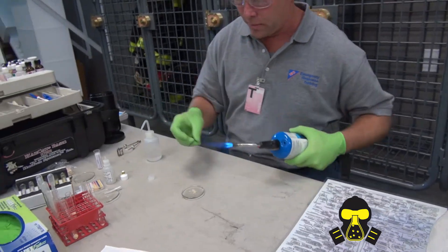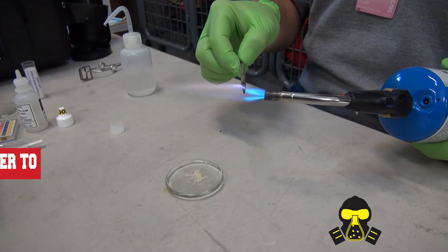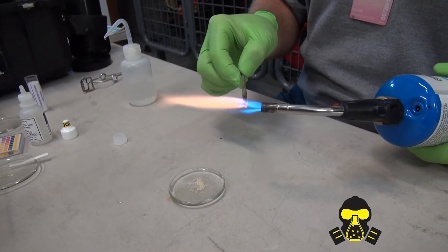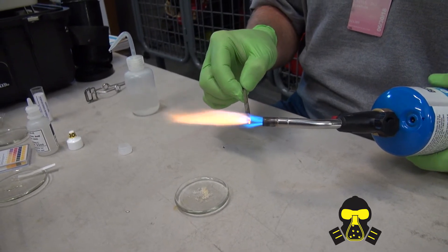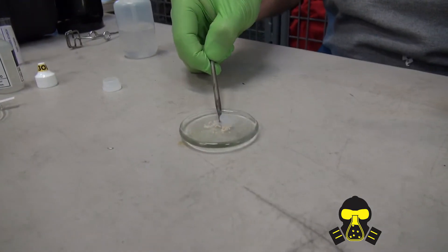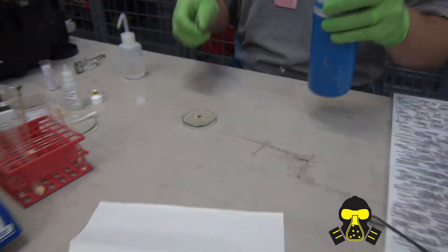Put that away. I'm going to do this one — the thermal analysis tool. There's some previous colors on there. You see the lavender right in there? That's from some kind of potassium material — potassium nitrate, gunpowder. We'll put this in here to see if it explodes or catches on fire. Nothing going on there, so it's safe for us to burn it in a test tube.